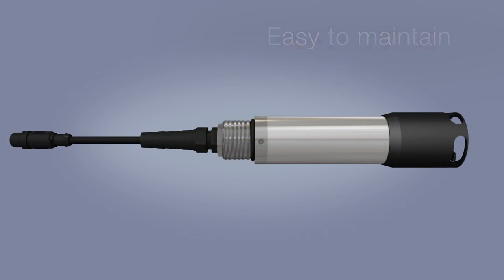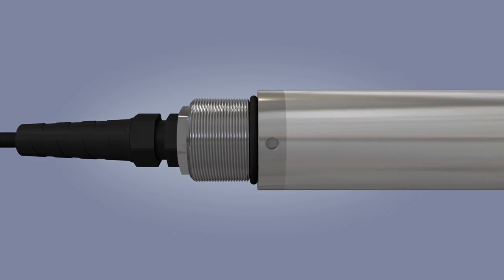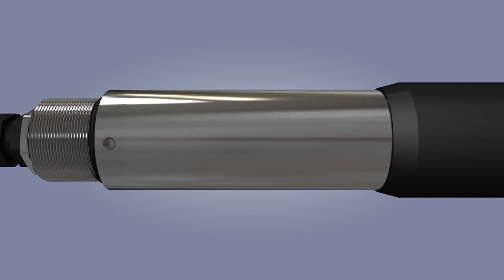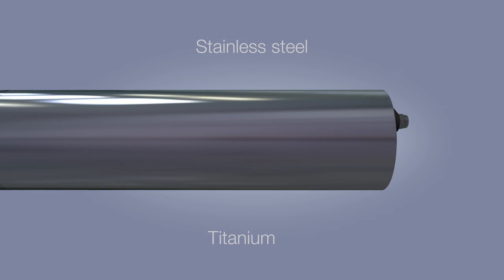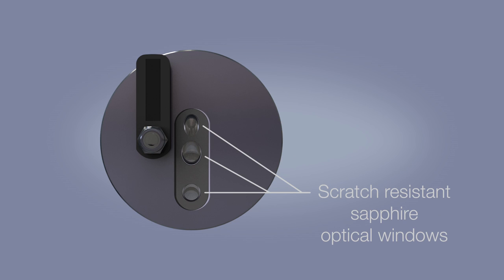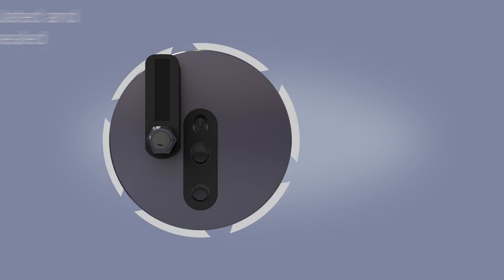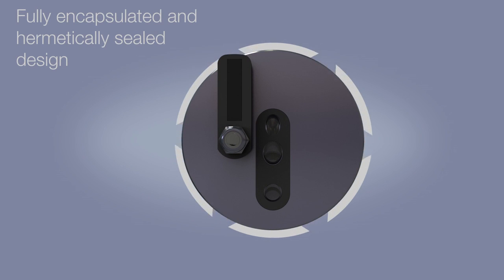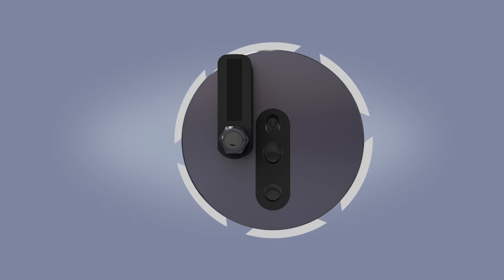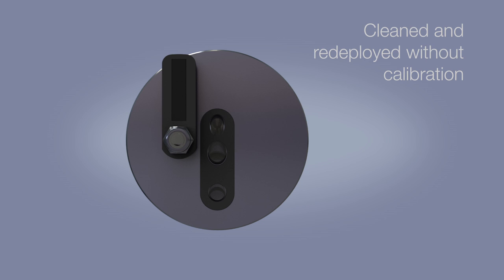The ATS430 sensor incorporates a range of features aimed at minimizing maintenance throughout its operational life. The robust sensor probe is available in polished stainless steel or titanium and features scratch-resistant sapphire optical windows to withstand the harshest environments and pressures. The sensor requires no servicing throughout its life, thanks to its fully encapsulated and hermetically sealed design. When cleaning is necessary, it can be cleaned and redeployed without calibration.